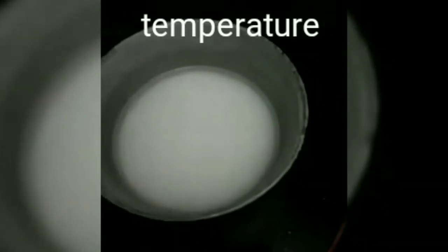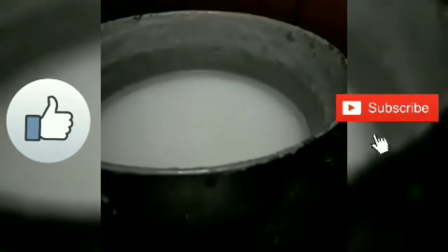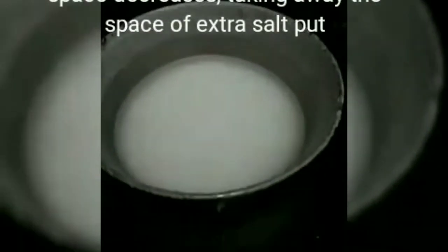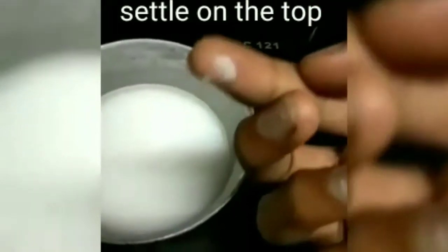We let it cool for some time and watch how the crystals of salt form. From the side view you can see two layers — one layer on top and another white layer beneath it, which is the salt layer. The crystals are going to come from there. It is cooling down quickly and you can see it is starting to look like a solid. These are the crystals of salt obtained.